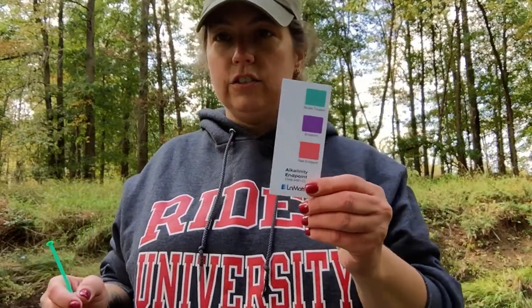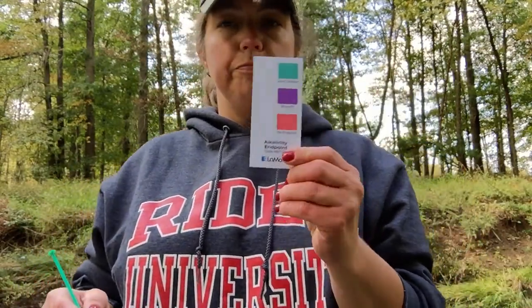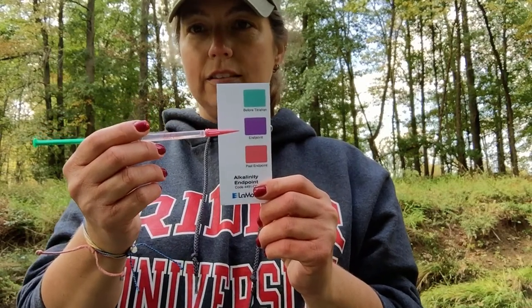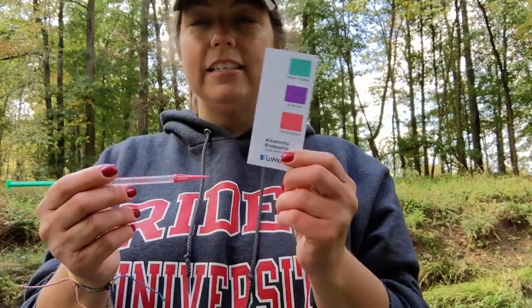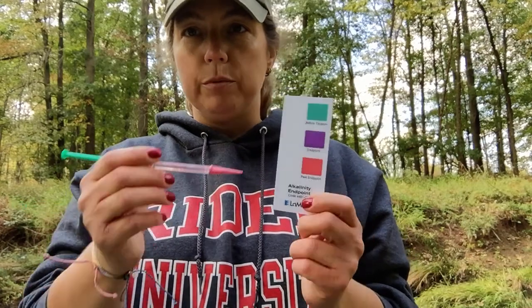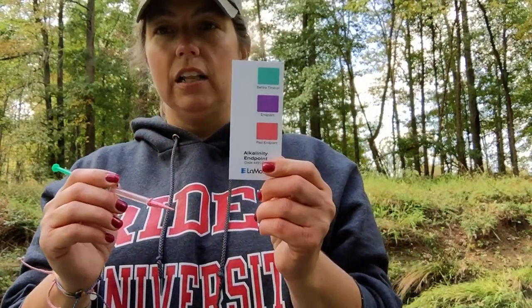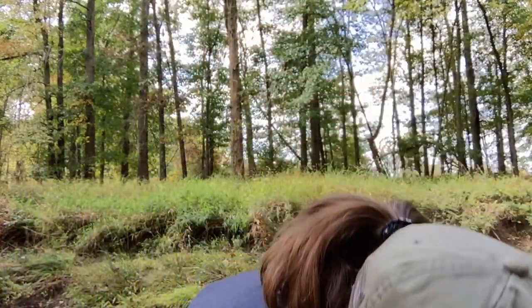Now I have to insert the titrator and titrate. Before titration it's going to be this blue-green color. The end point is going to be a purpley color, but past the end point - literally one drop - you go from purple to a pinky color in one drop, and it frustrates the heck out of kids.